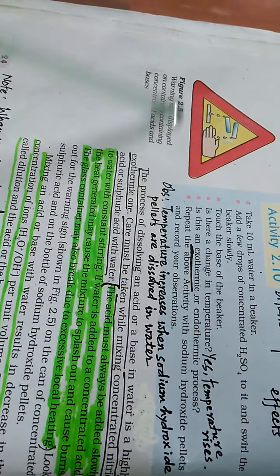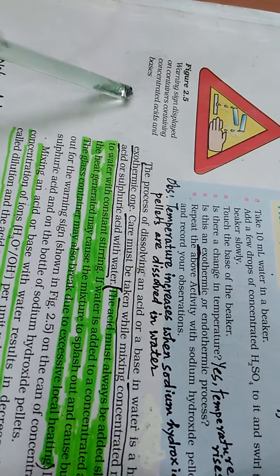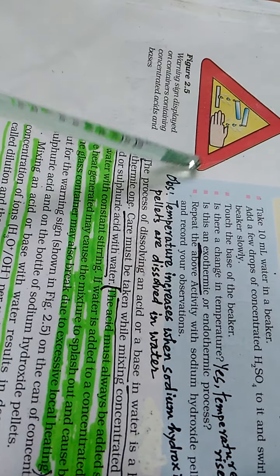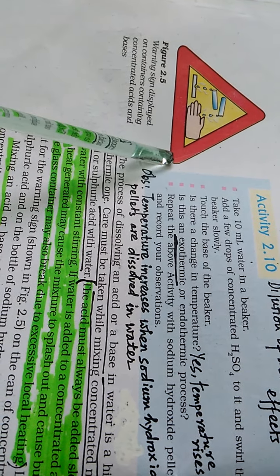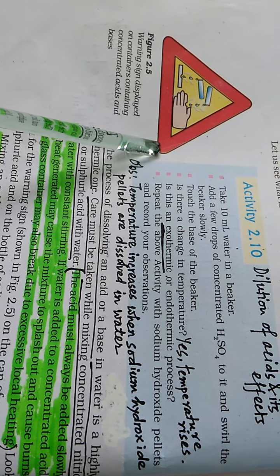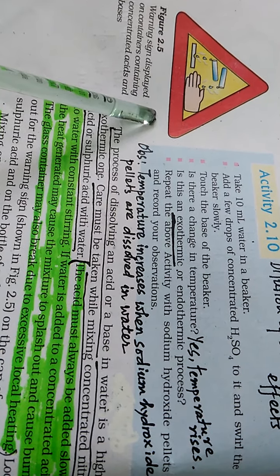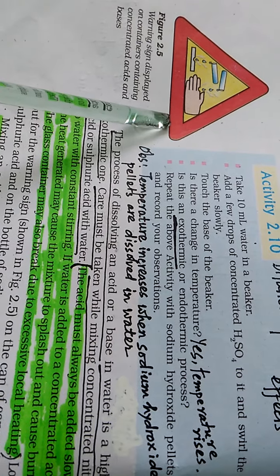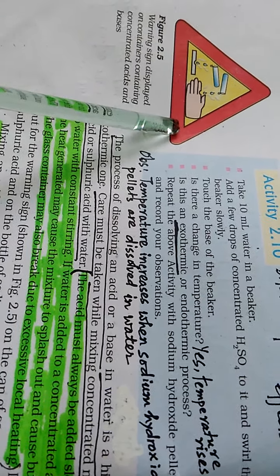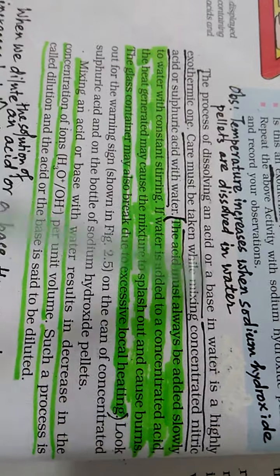You can see this warning sign which is displayed on containers containing concentrated acids and bases. This warning sign shows that acids and bases, when they are in their concentrated forms, are highly corrosive. Means these chemicals can damage your skin or other body organs. So you should be very careful while working with a strong acid and a strong base when they are in their concentrated form. The process of dissolving an acid or a base in water is a highly exothermic one.